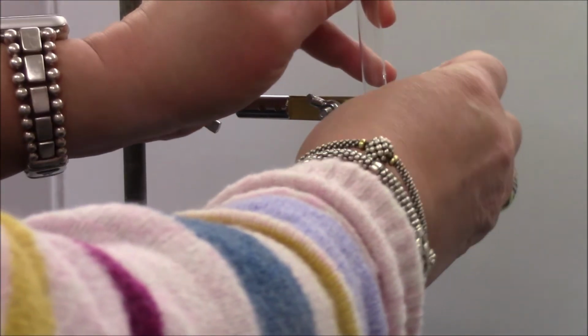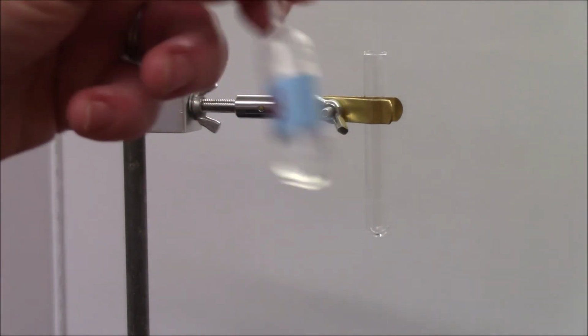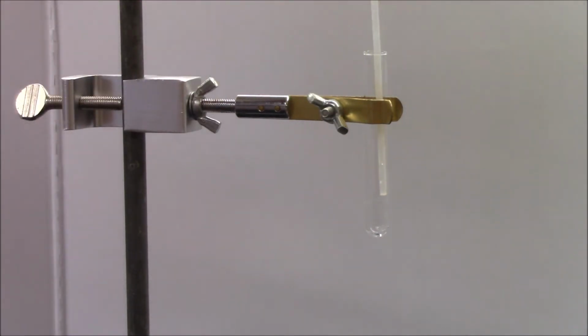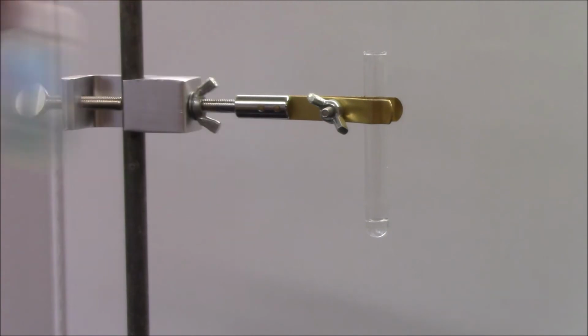In our next reaction, okay, we have lead nitrate, which we've already observed before as being transparent and colorless. And then we have potassium iodide. Okay. Here's potassium iodide. Maybe you can see that it has a very pale yellow color to it. When I add it, look at that. Canary yellow precipitate. So the solution turns yellow.